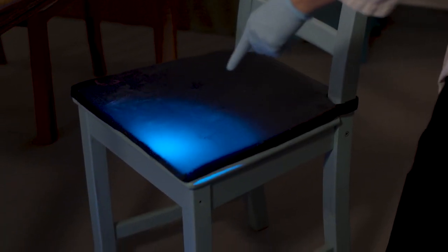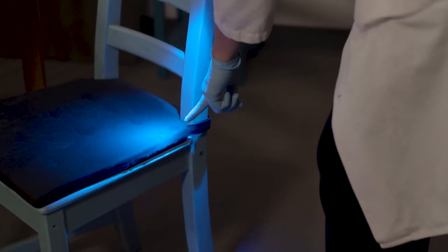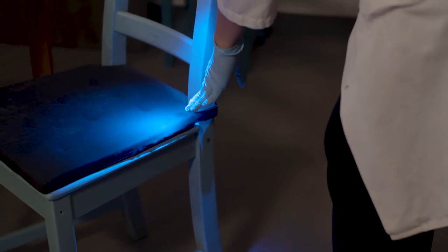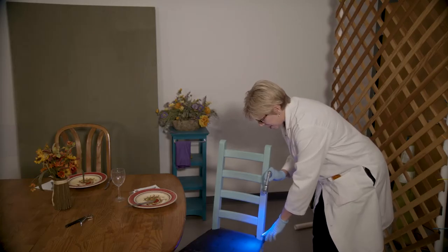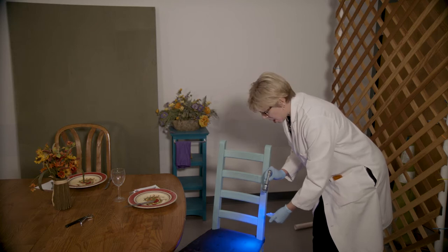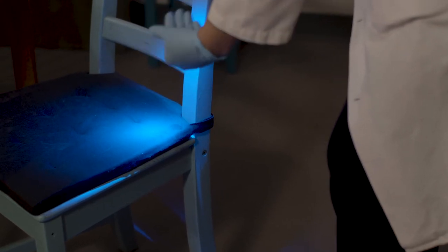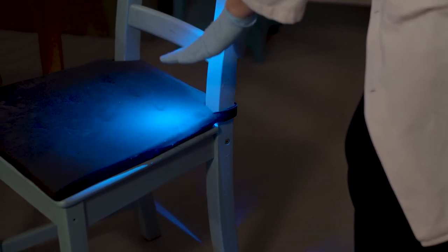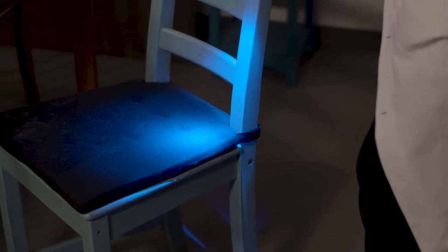As we keep looking along the chair, we'll notice some other staining. Now this is potentially blood. It looks kind of reddish brown, but the one thing I want to point out is that this blood or dark stain does not fluoresce under an alternate light source — rather it quenches the fluorescence. So unlike what you see on TV when you hear someone say the blood fluoresced, this is not the case. But this is also something that may not be visible with just white light.